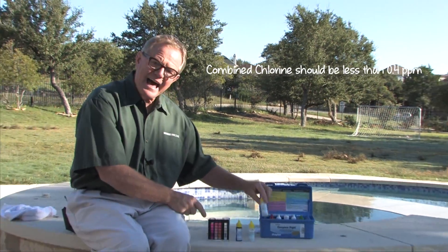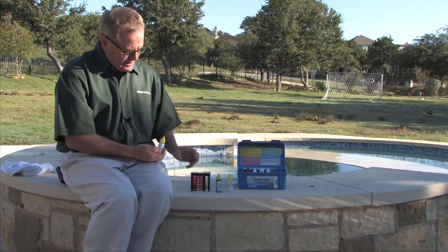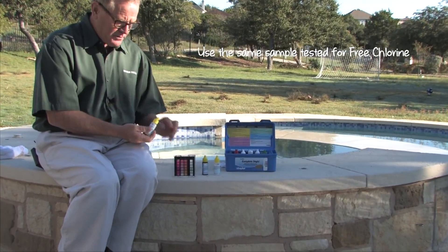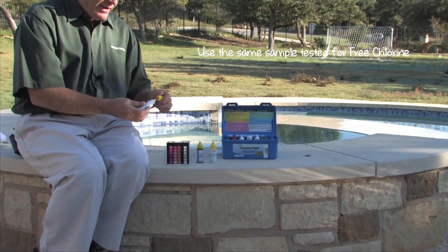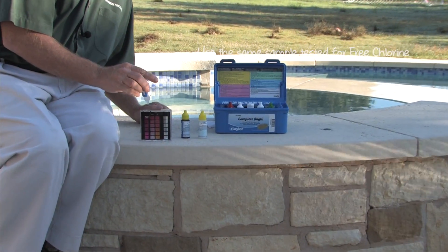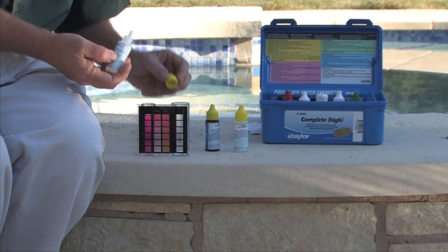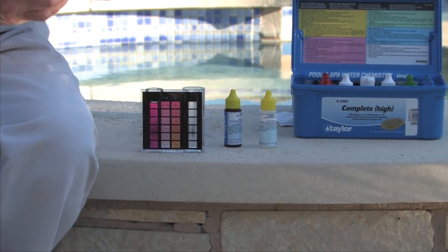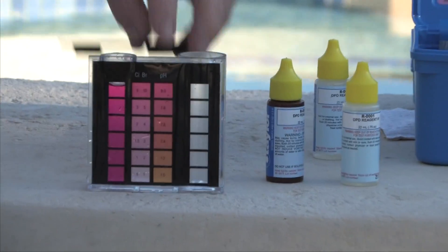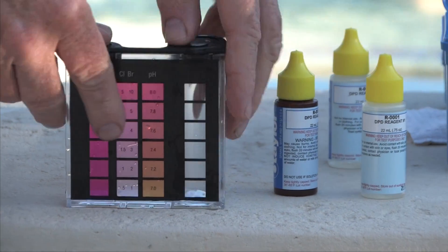So with this exact sample — if we have three parts per million free — we will add five drops of reagent three. If the sample gets any darker red, we know we have the presence of combined chlorine.